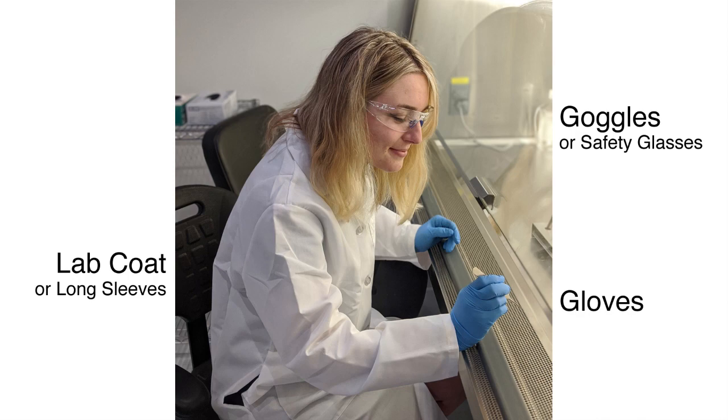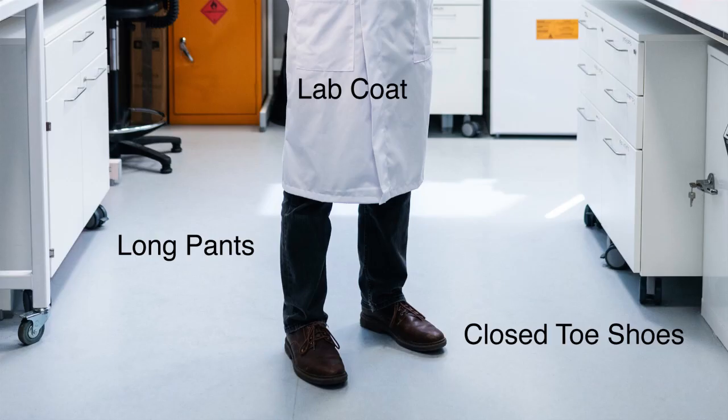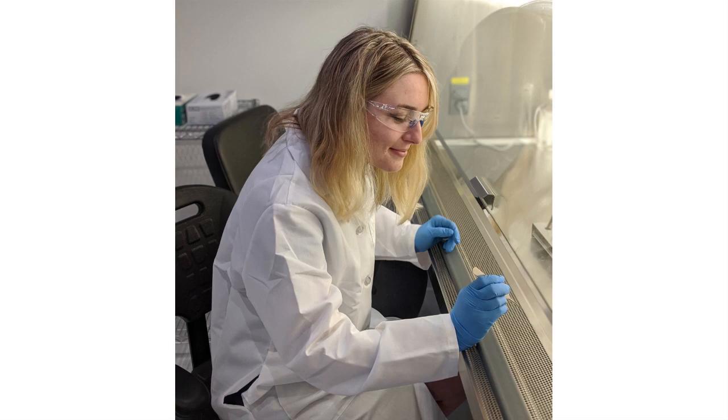Safety. Safety glasses, goggles, lab coat, gloves, and closed-toed shoes are needed. The hood is used for the synthesis.